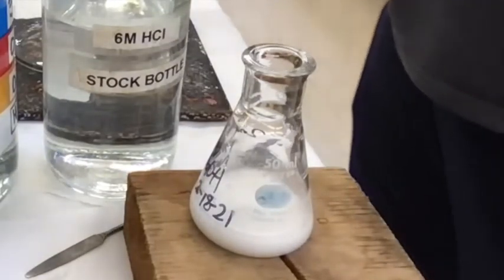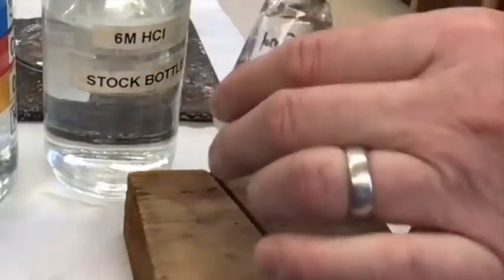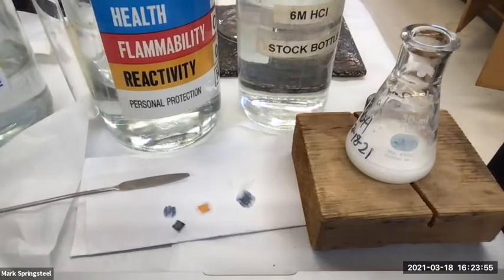Should we just assume it's acidic or should we test it? Test. Always test it, because sometimes you're super close but not there, and then the problem is you won't get a good yield. So let me check it. Oh, it's still not quite. Do you see that? It's not pink, huh? Oh. Not quite there. Good thing we checked.